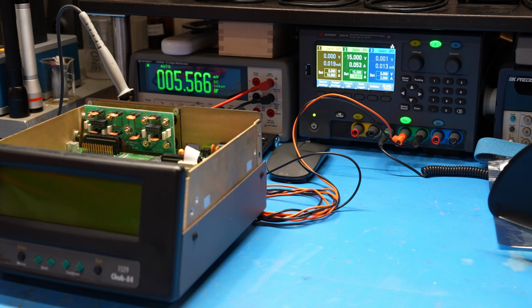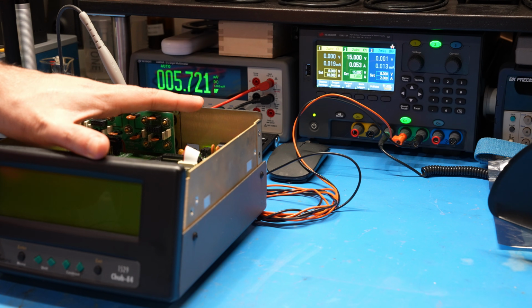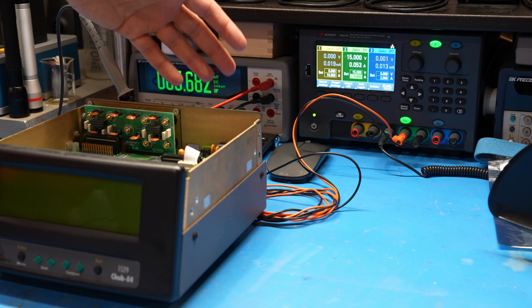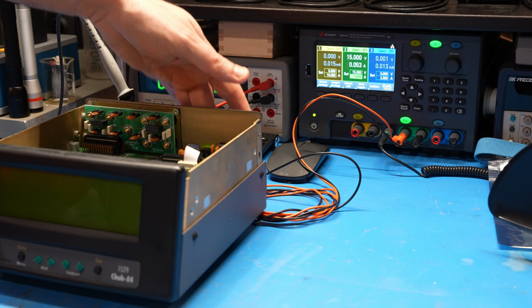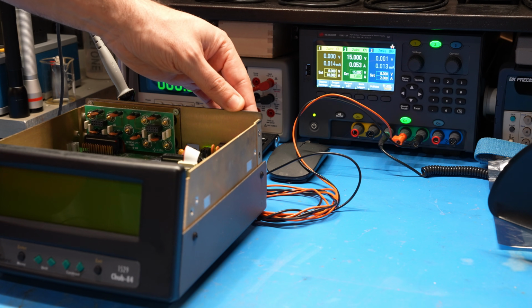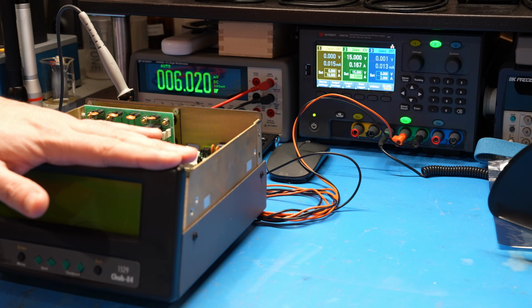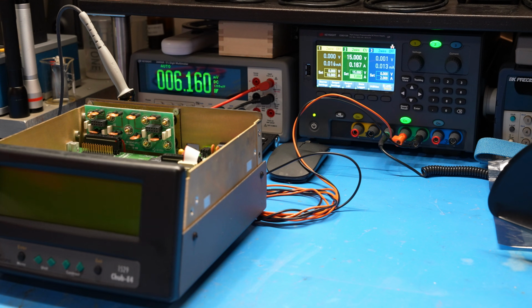Okay, so let's do the same experiment again. I have the instrument connected to 15 volts. Right now it's turned off and it's drawing 53 milliamp, which I think is the same as before. The LED charge light is also on. Let's go ahead and turn the main switch on here. And okay, well, there's nothing on the display. That's unfortunate. But we do see that it's drawing 167 milliamp, which is considerably better than it was before. It was putting itself into constant current at 1 amp.